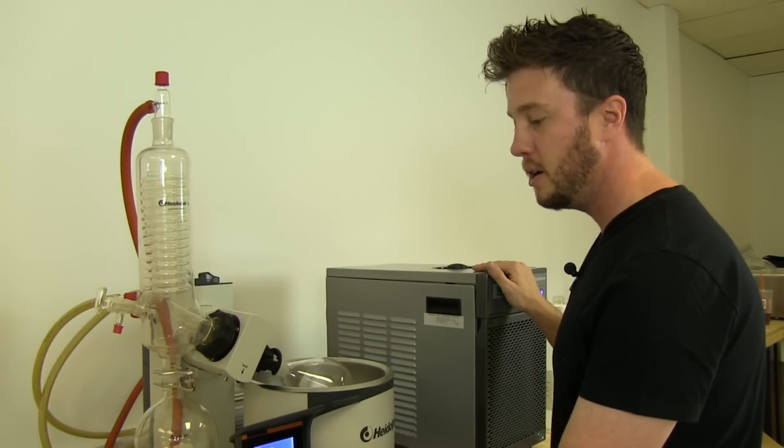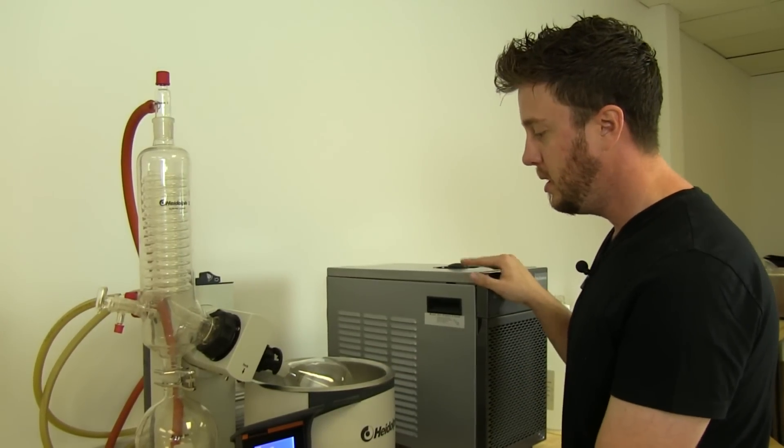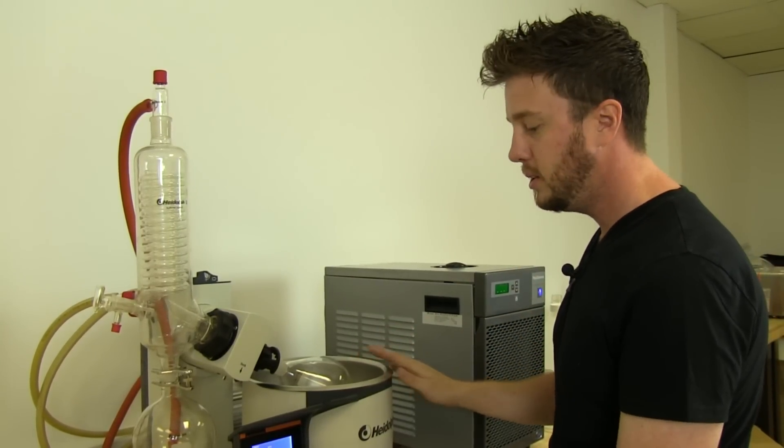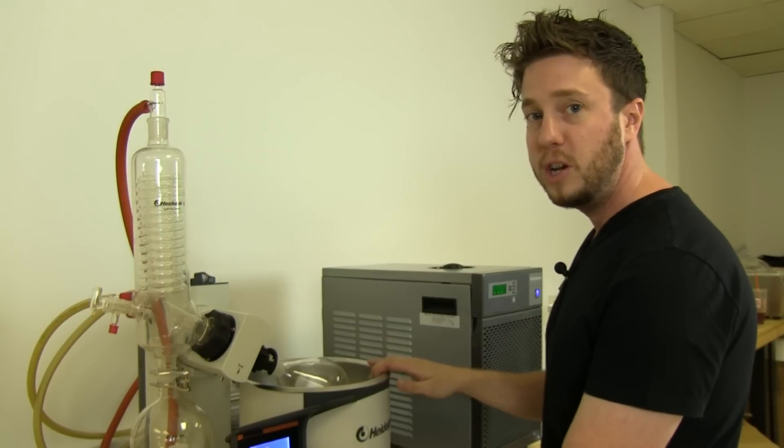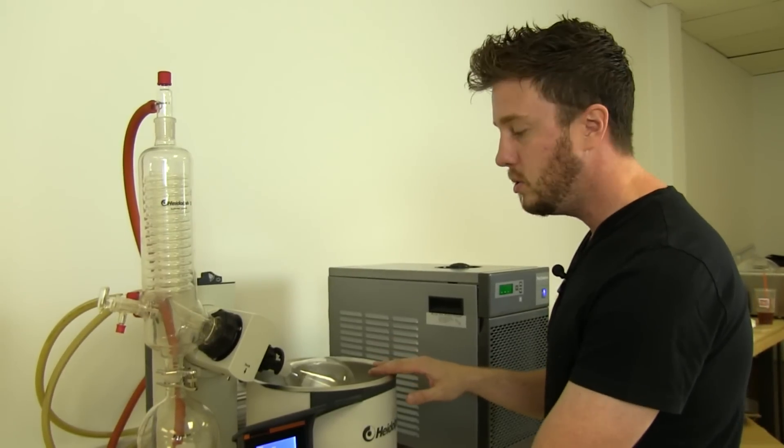Okay, so now that we have the entire unit assembled and all components are in place, we can start filling it up and get it ready to start.